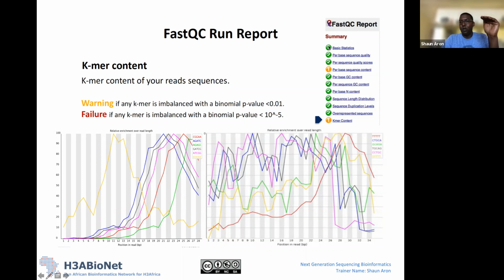In most instances, it will come up. I didn't mention this before, but when FastQC runs, if you get a tick, that basically means that your data looks good. If you get an exclamation mark in yellow, that means that it's in between. And if you get a red X, that means that based on what FastQC thinks, your data has failed that particular metric. The ones in yellow, you always need to look at with a bit of caution. So this one I would say just look at it with a bit of caution as well.